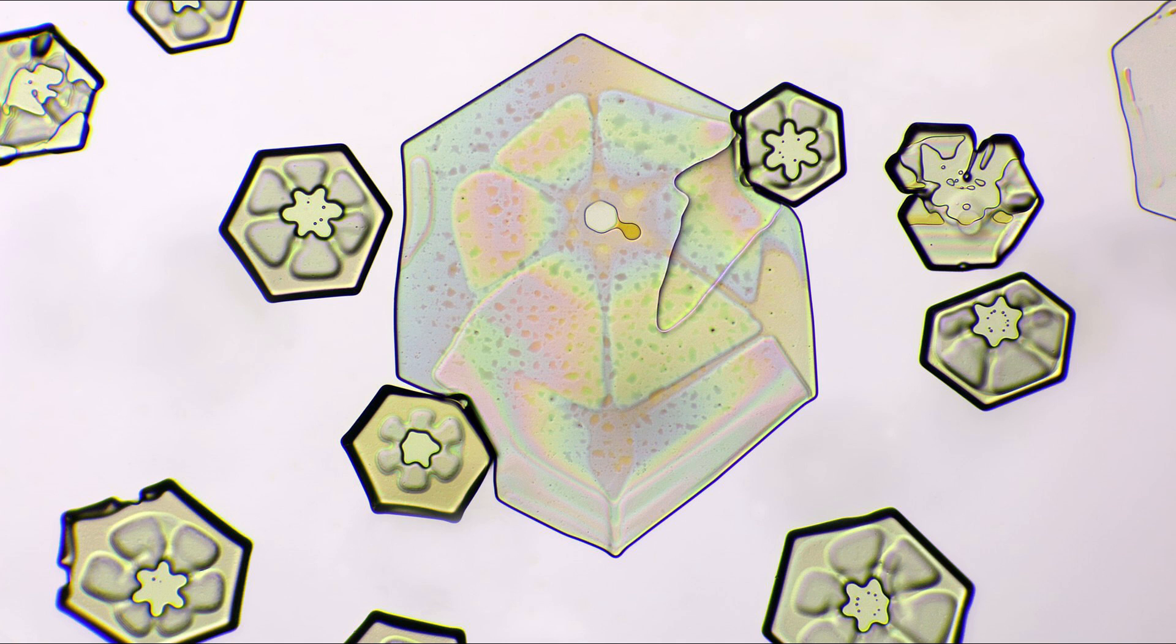I tried to make such photos myself, but I obviously couldn't get such great pictures of the crystals, but I think mine still look nice, kind of.